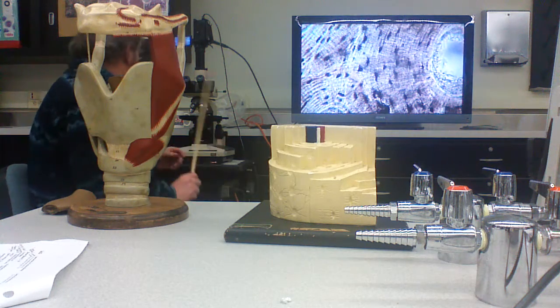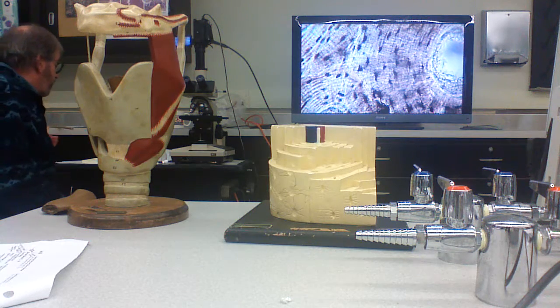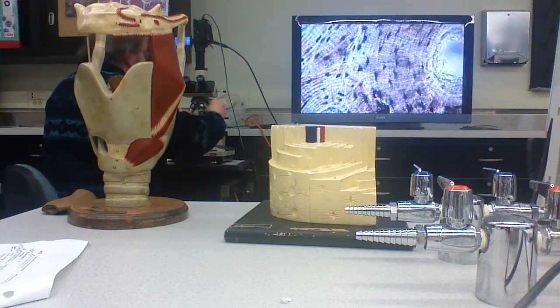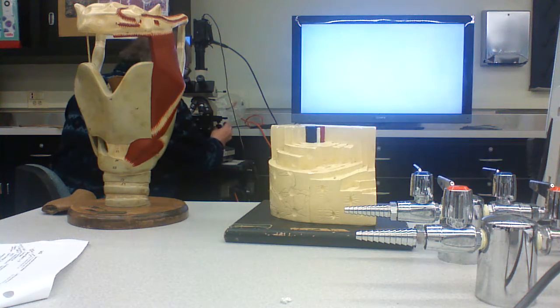These cells are really active metabolically. Now in longitudinal section, you won't necessarily see that cylindrical meshwork or substructure.